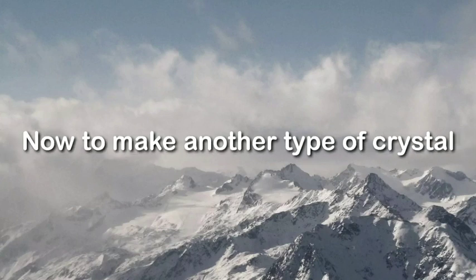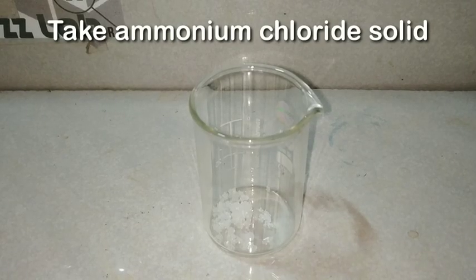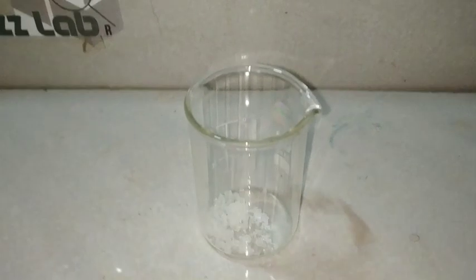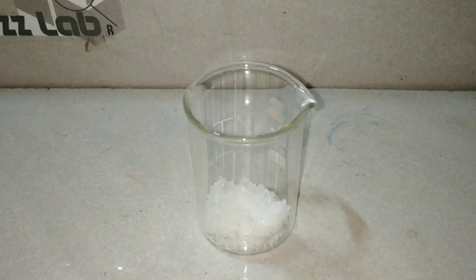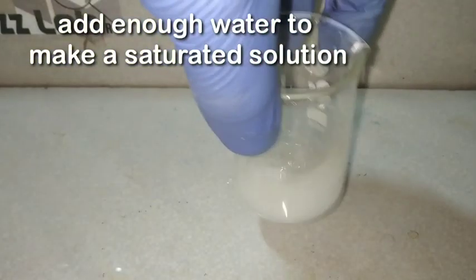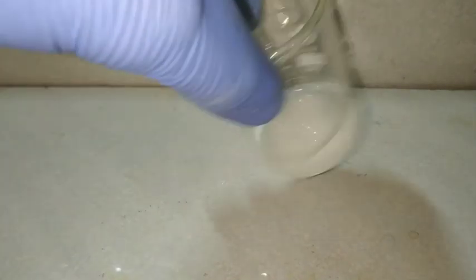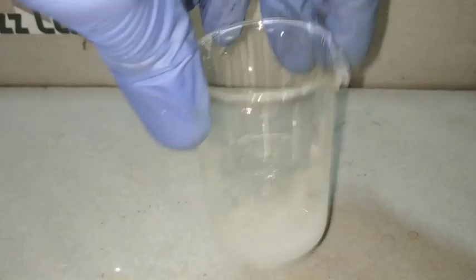Now we will be collecting these golden yellow crystals for our globe. We will also be making another type of crystal — for this we will need ammonium chloride solid. I have taken ammonium chloride in this beaker and will add a very little amount of distilled water into it to make a saturated solution. We will heat the solution so that the crystals get dissolved, and then we will keep the solution for cooling.